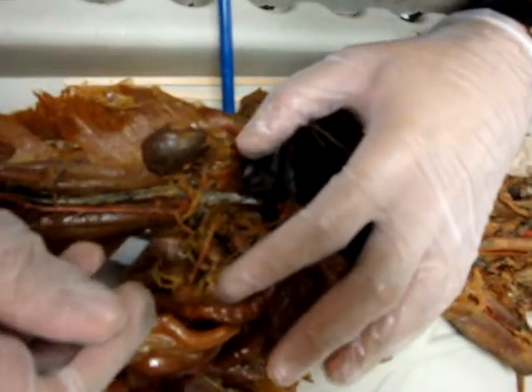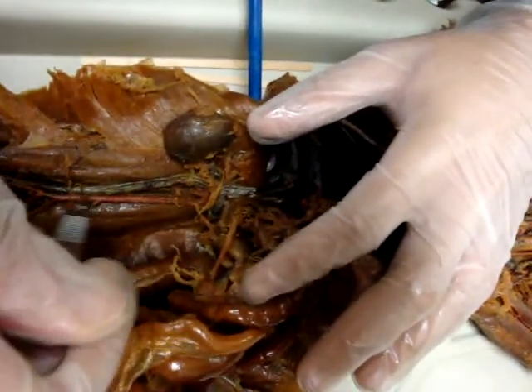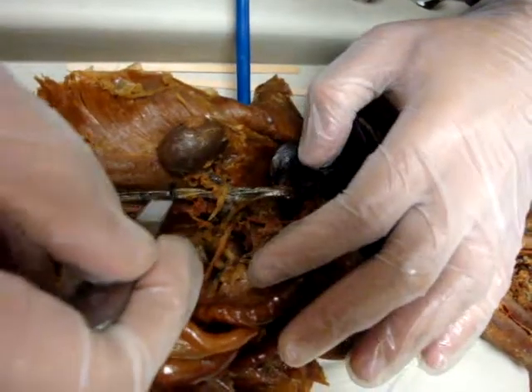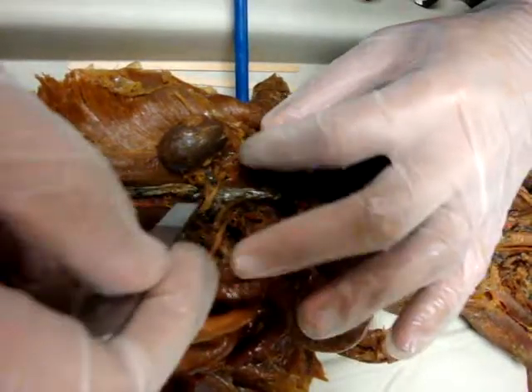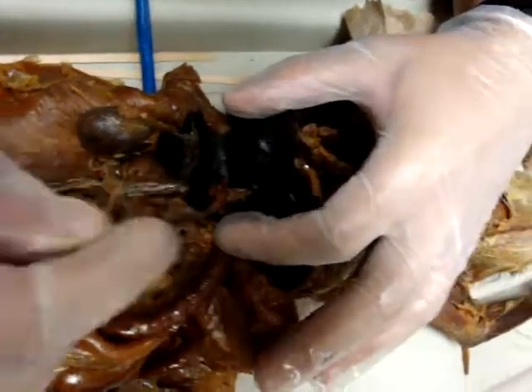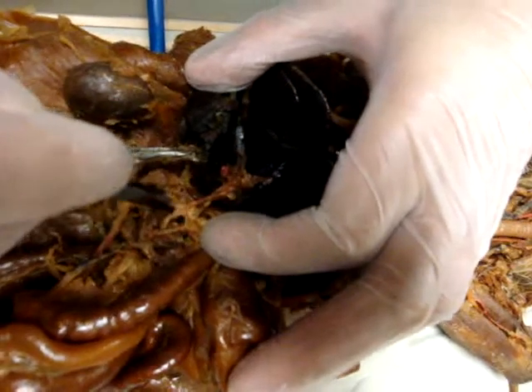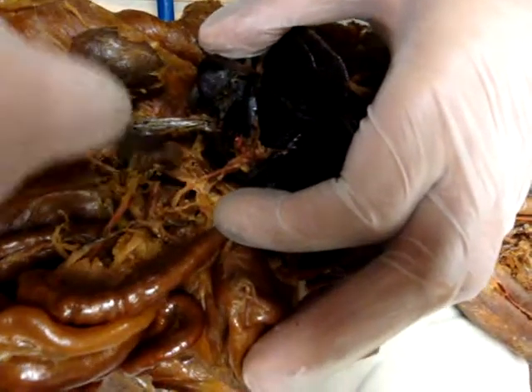This is the descending aorta, this is the inferior vena cava, this is the kidney, celiac trunk. Yeah, this cat is good. This is the celiac trunk right here.